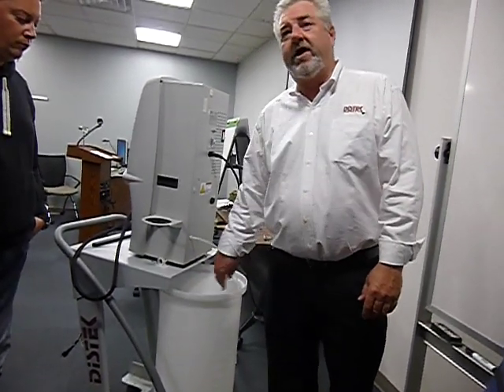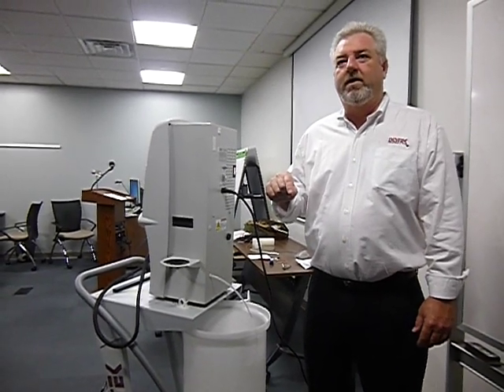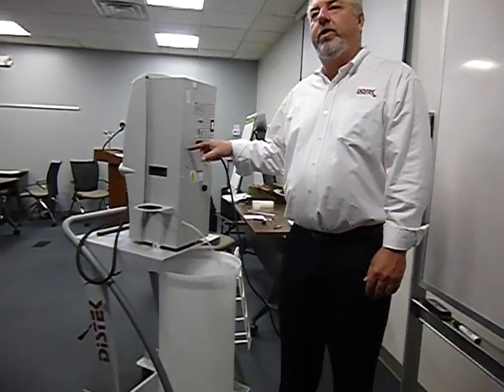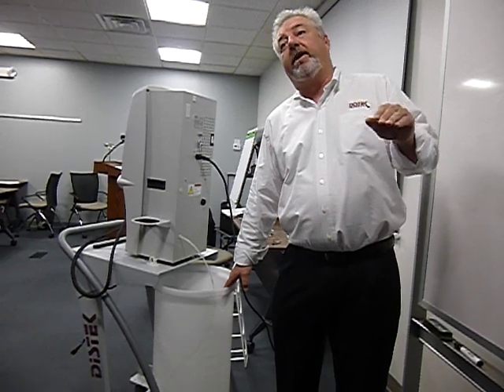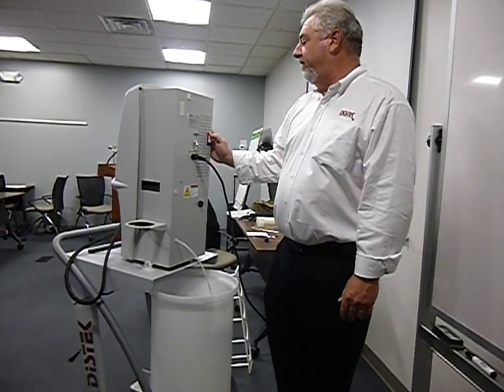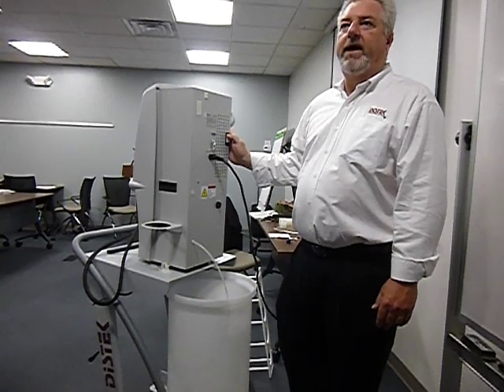So what happens to the reservoir each time you use this? It increases the temperature, but decreases the oxygen level in here. It blows air through the reservoir, but you're putting degassed media back in there. So every time you use it, the reservoir is going to get a little bit warmer, and the oxygen level is going to go down a little bit. Now we power it up, and what happens when we power it back up? Self-test. I will say pass.